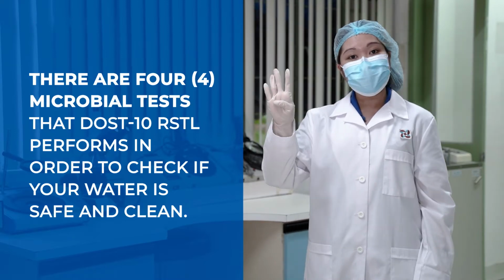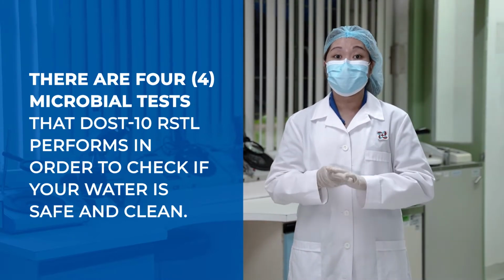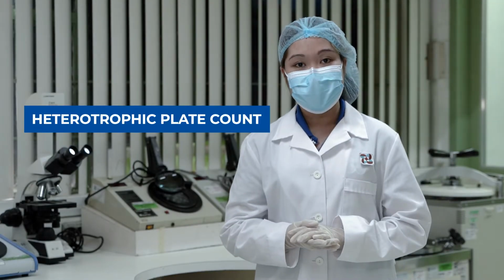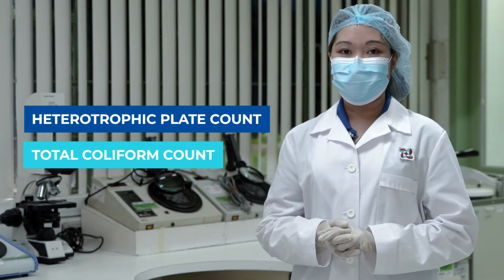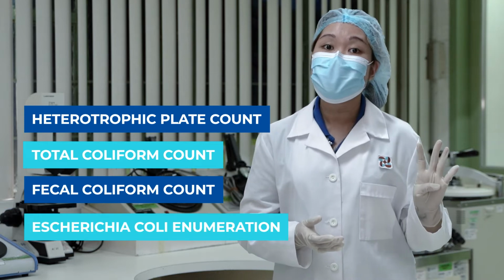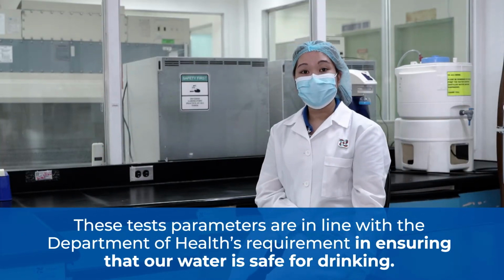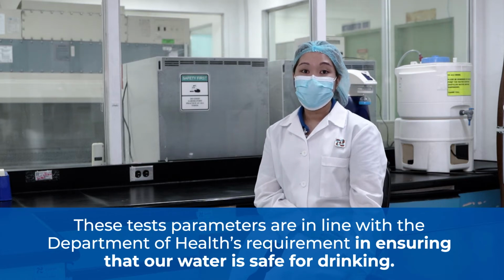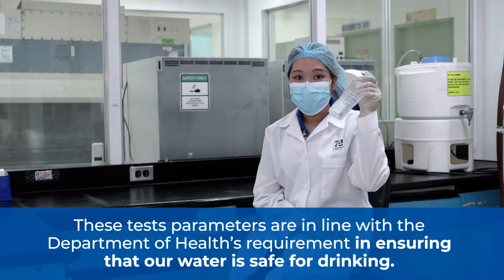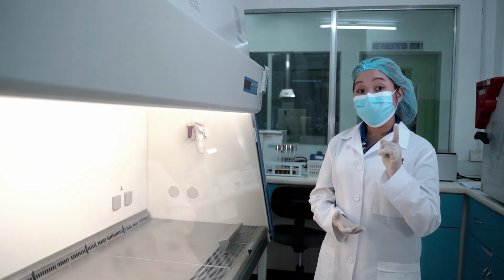There are 4 test parameters that DOST-10 RSTL performs in order to check if your water is safe and clean. First, heterotrophic plate count. Second, total coliform count. Third, fecal coliform count. And lastly, Escherichia coli enumeration. These test parameters are in line with the Department of Health's requirement in ensuring that our water is safe for drinking. So now, I'm going to show you how your water is being tested.